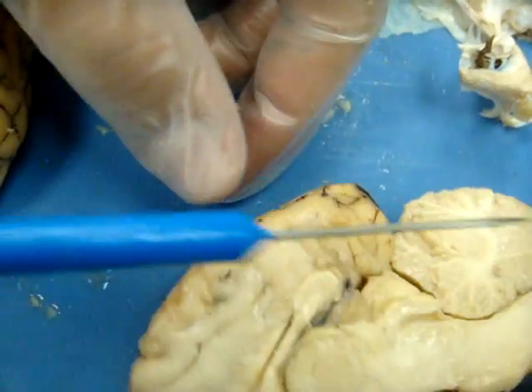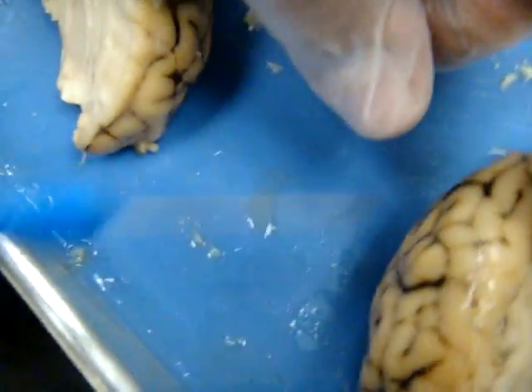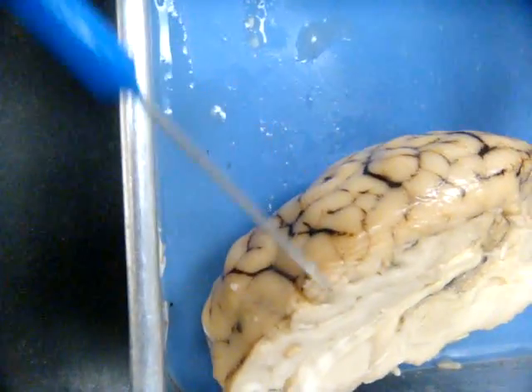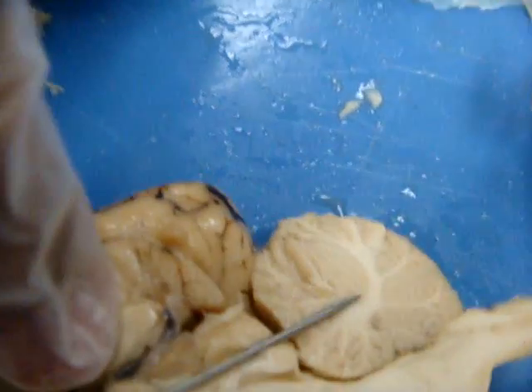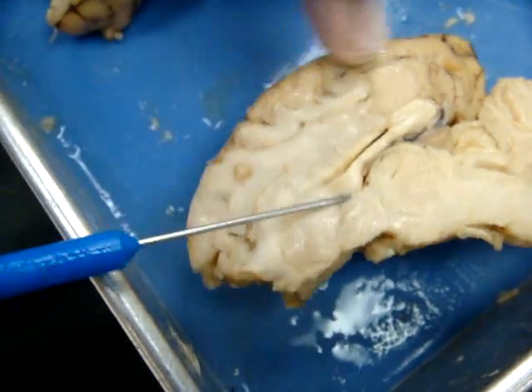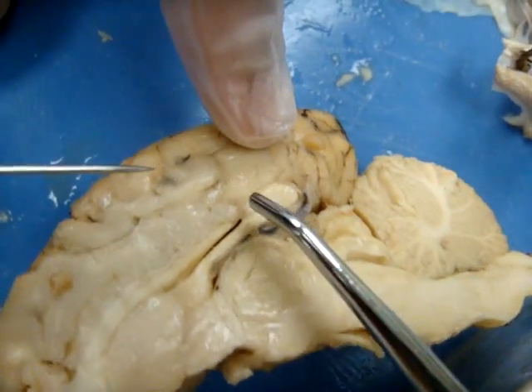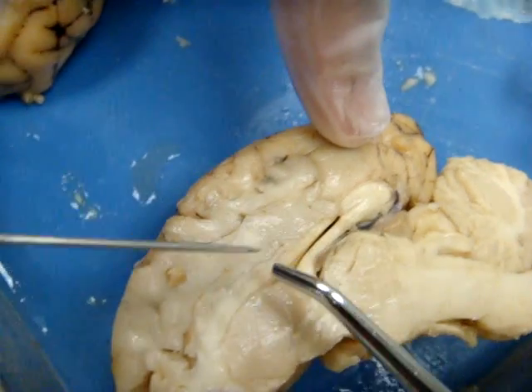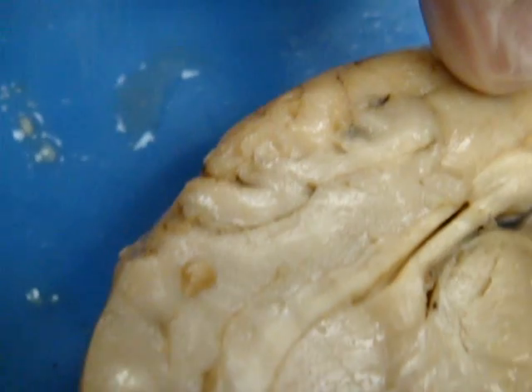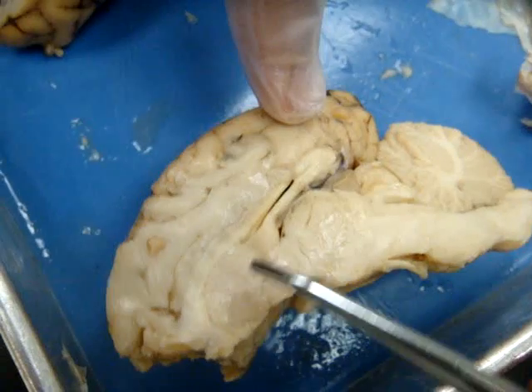Cerebrum is the top lobes of the brain. Cerebellum — the cauliflower-looking stuff. Corpus callosum runs along the top of the lateral ventricle — that white part running along the top of the lateral ventricle and up in front of that part.